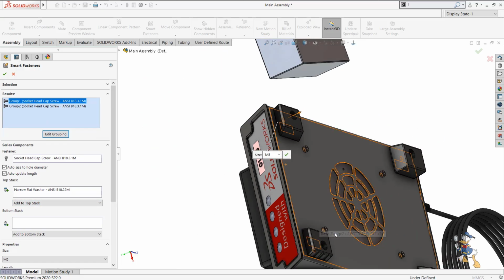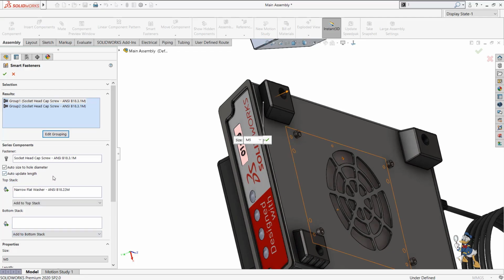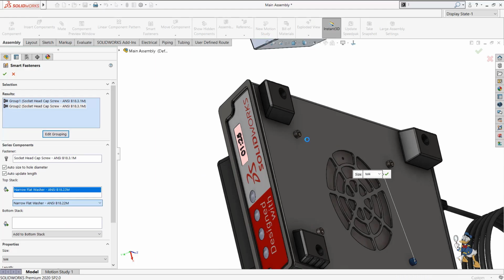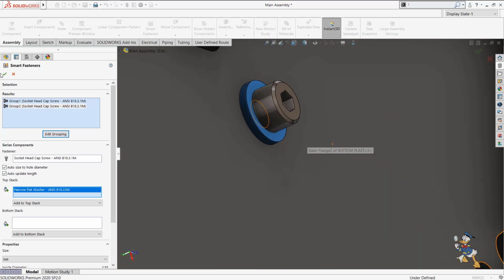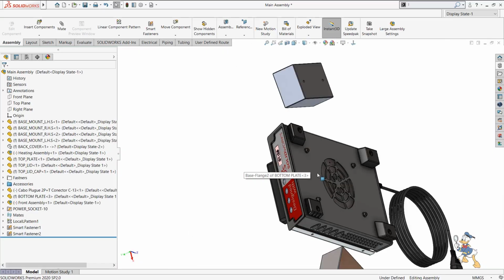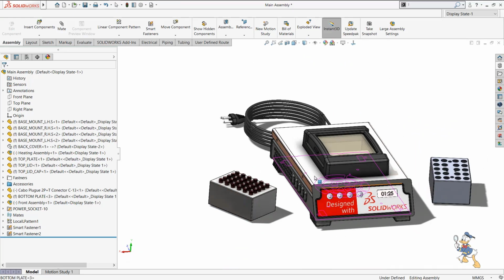Yeah, we can add a washer facility. Suppose I just need to add a washer to this, and this will add a washer. We can see it adds a washer to this feature, and then I just need to check it out, and it will generate fasteners for us without inserting some sort of fasteners manually. We can insert the smart fastener feature. We can use the smart fastener feature and make our assembly easy.